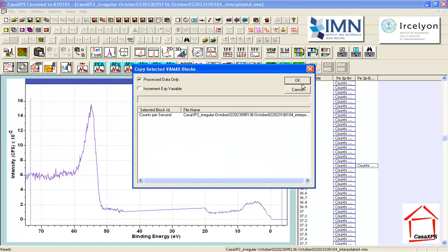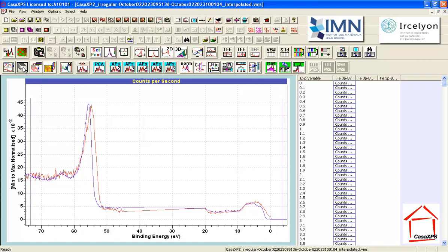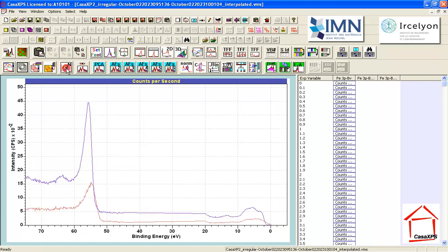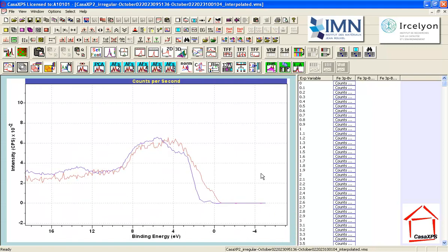So I'm going to save that. And this is an iterative process; I can't claim that my first attempt at understanding these data will make sense. But I see something now in these data, which I turn off the normalization. That was a display form of normalization. There's also a numerical adjustment to the data that will alter the relationship of these two spectra. If I press this normalize button, this will normalize the intensities. And I can see now I have a clear difference in the shape and the position of these iron 3P. And I also have a very clear difference in the shape and position of the valence band spectra.